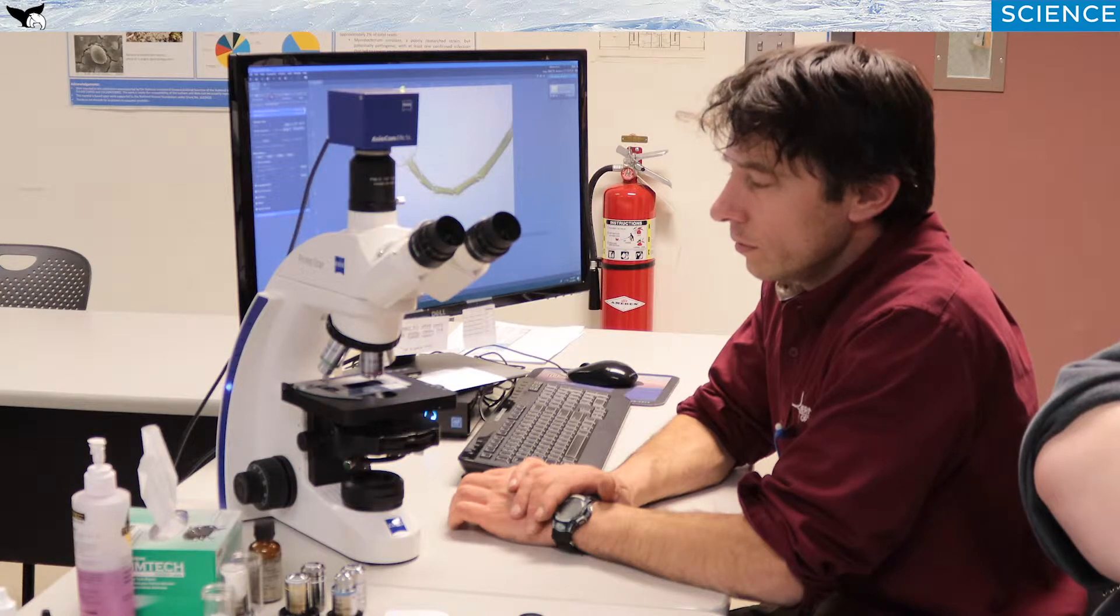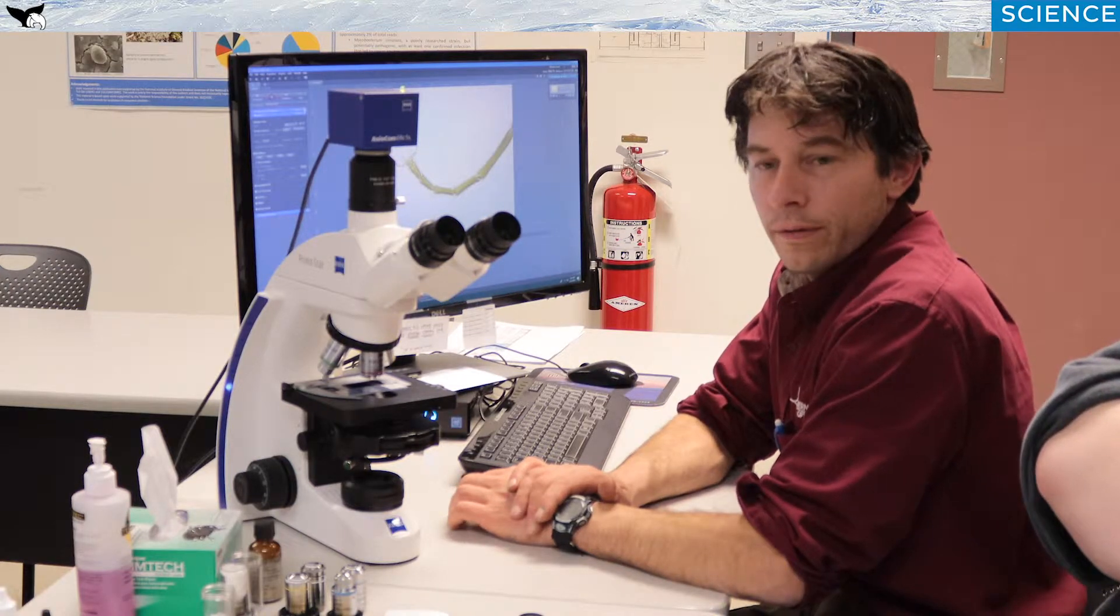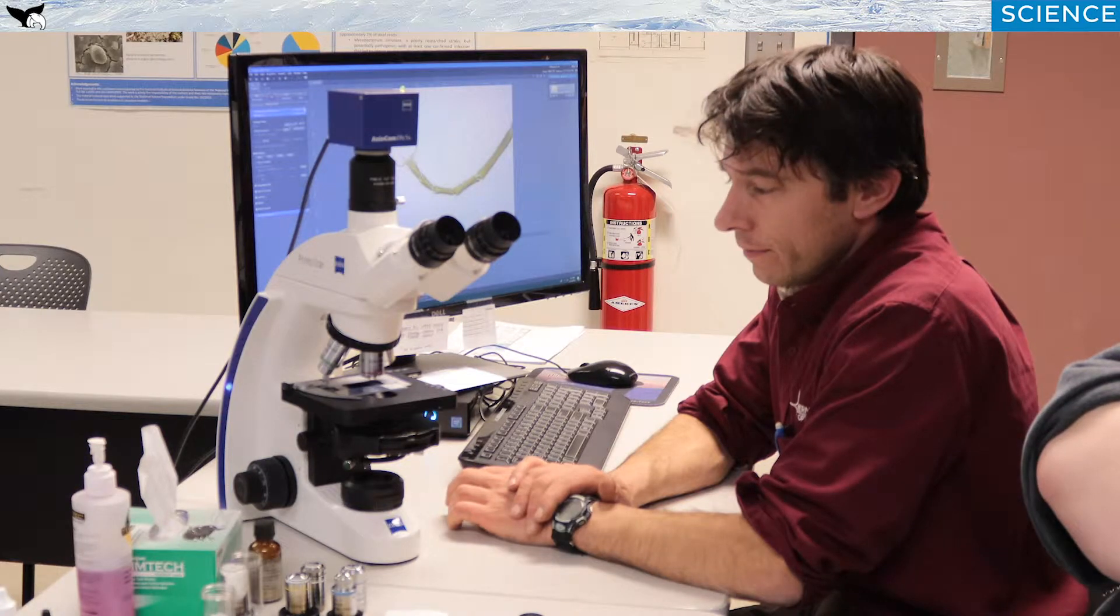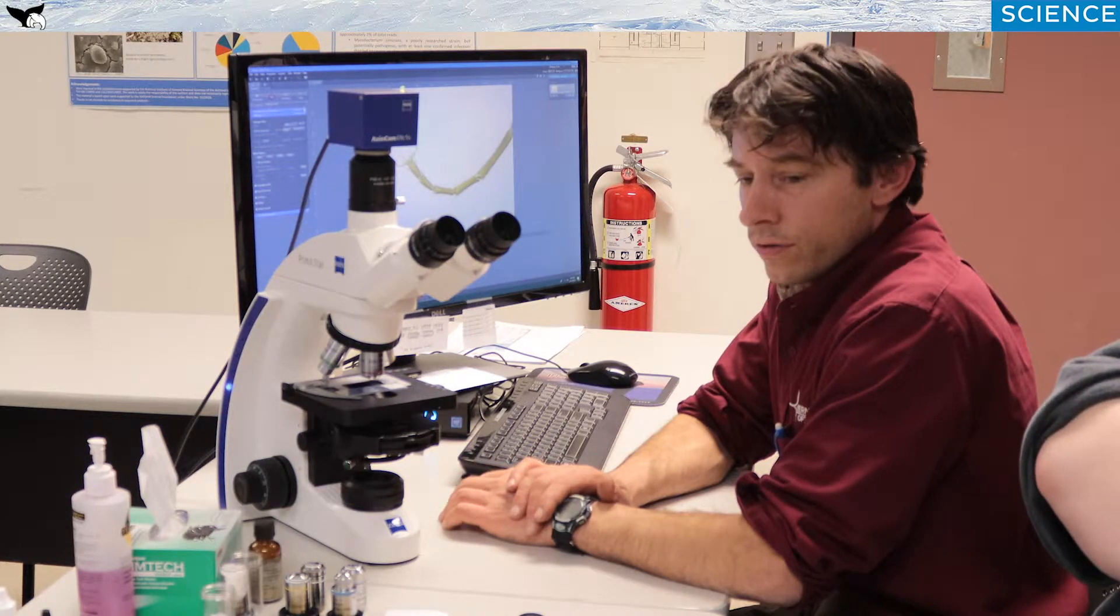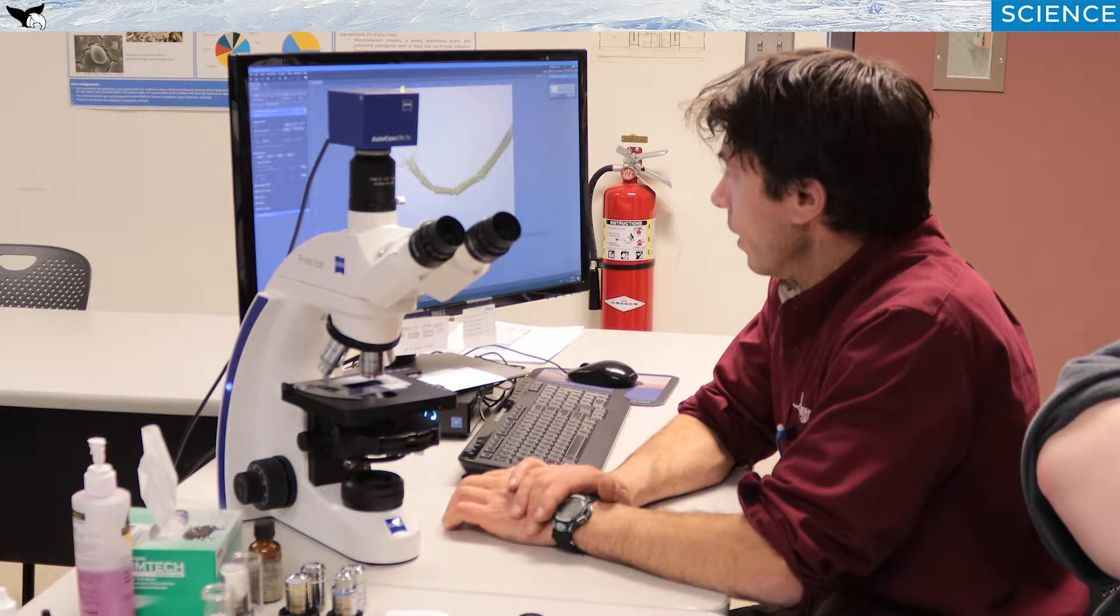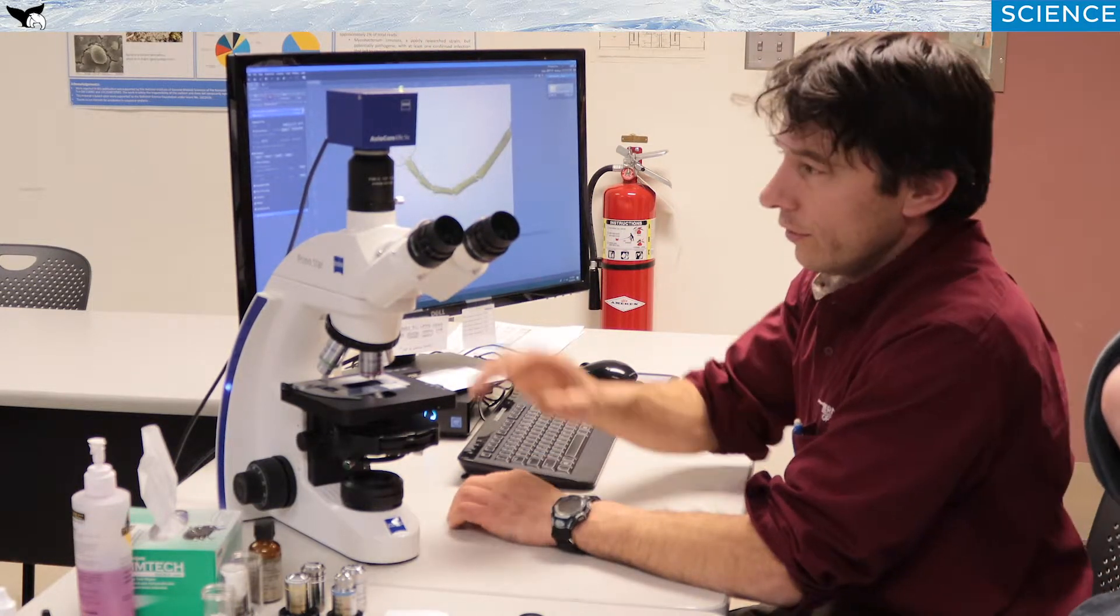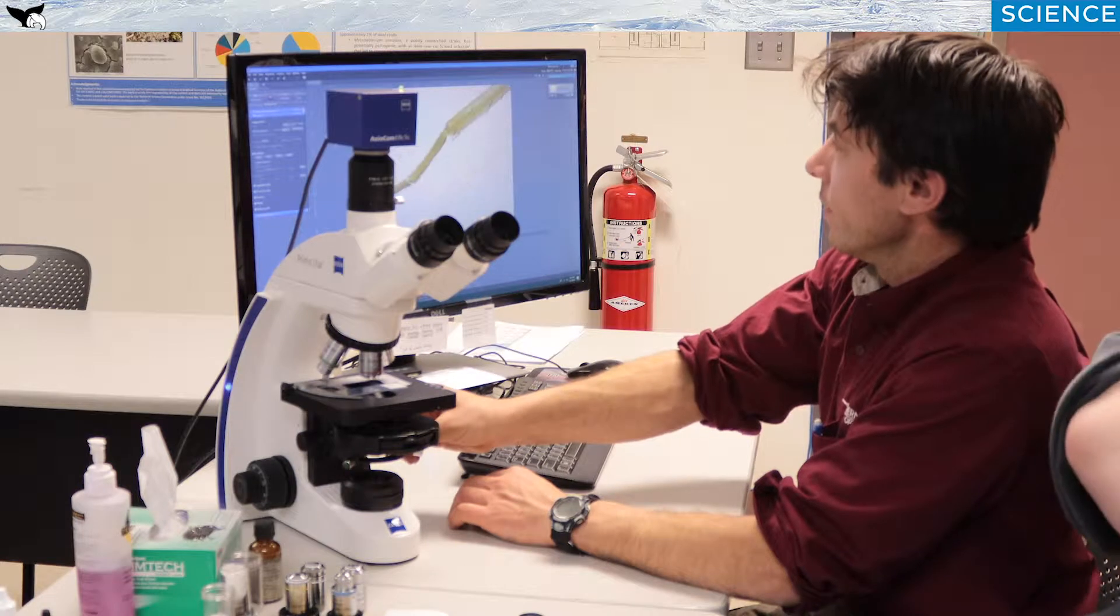I am going to show you how to use this microscope, how to maintain it, how to troubleshoot it, and then finally I'm going to go over how to try to get a better resolved image. I'll utilize the screen here for you to see as well what is going on live on the camera.